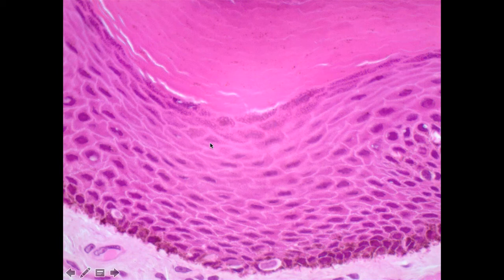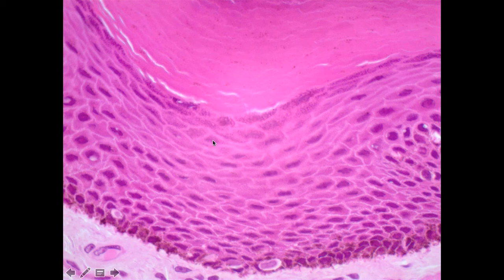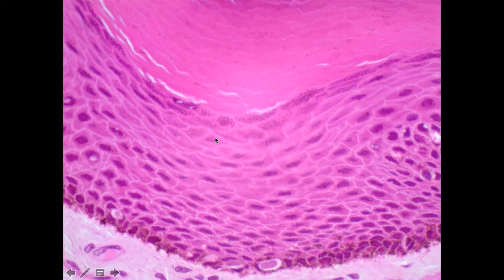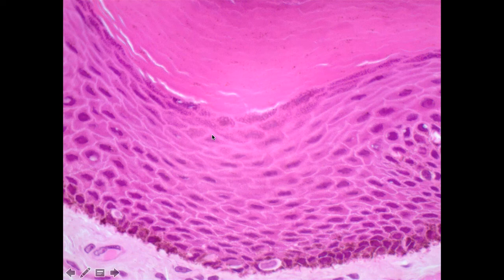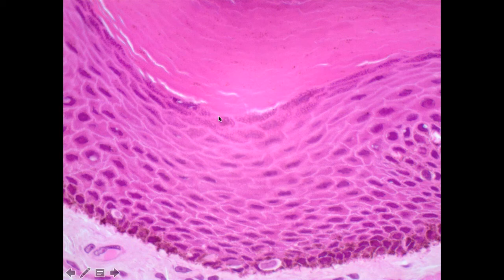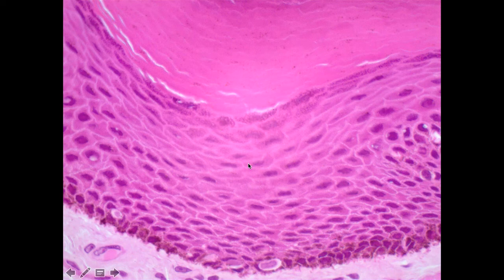As we continue to move up, we then move into our third layer. This region, maybe three to five cell layers thick, is referred to as the stratum granulosum. The stratum granulosum is composed of cells that have now acquired granules — the name granulosum reflects how they appear under the microscope. These granules are referred to as prekeratin, which is an immature form of keratin slowly becoming more mature. This layer tends to be really easy to see because it is darker stained than the layers below or above it.